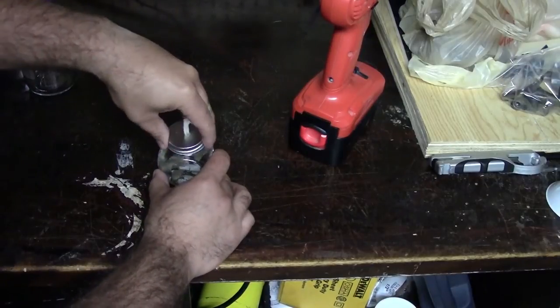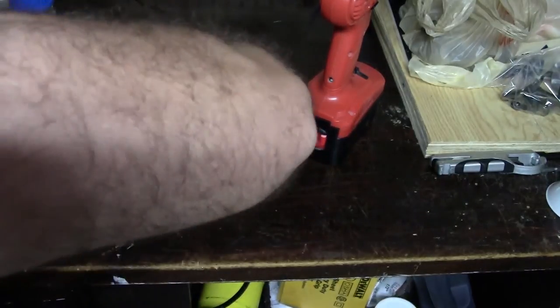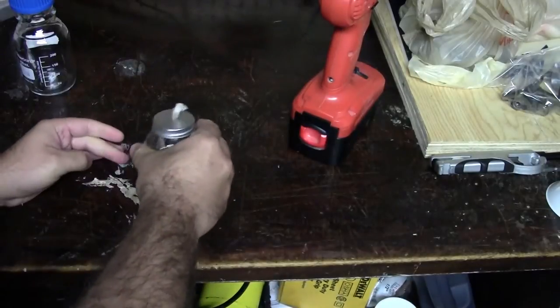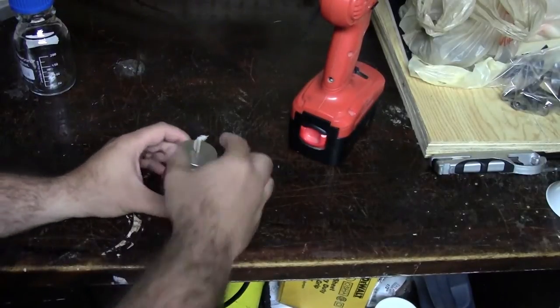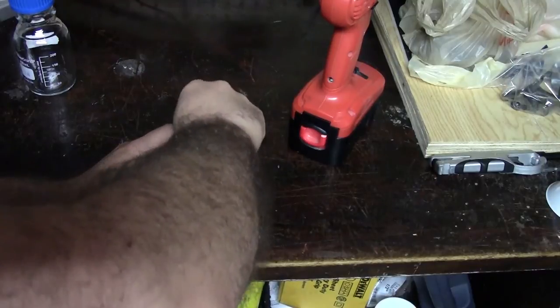Attach your lid with the wick in the fluid. Make sure the wick is wet. I actually have a little bit more wick sticking up here than you want. Normally you just want a small, about a centimeter long piece.